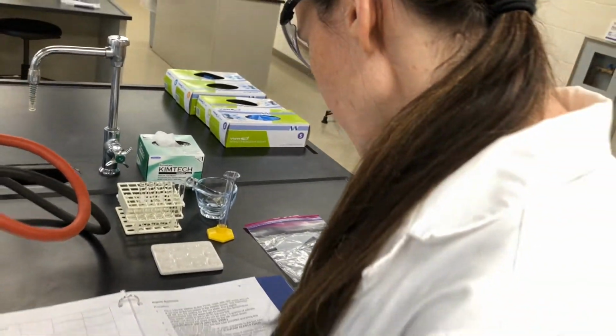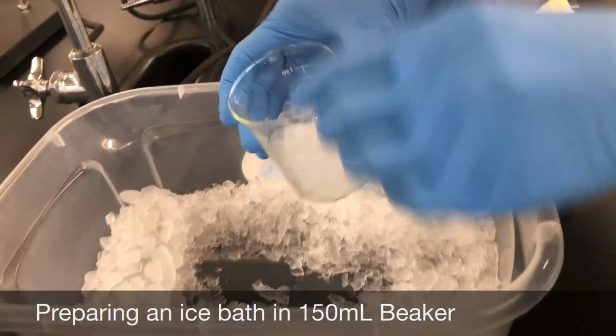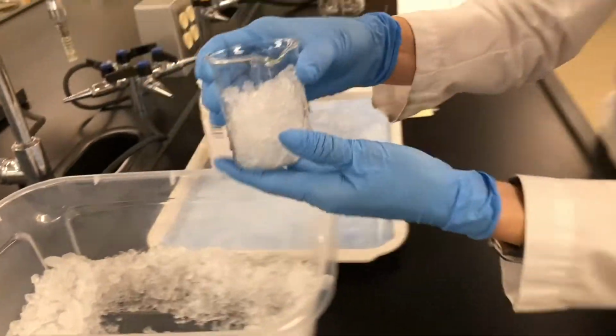Okay, so next step is to fill a 150 mL beaker with crushed ice and cold tap water to the 100 mL mark. Okay, so here we go. Whenever you're making an ice bath, you want a lot of ice and just a little bit of cold water.